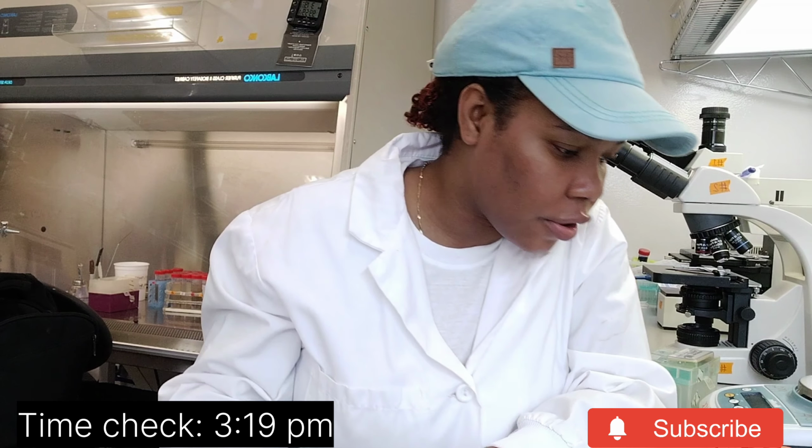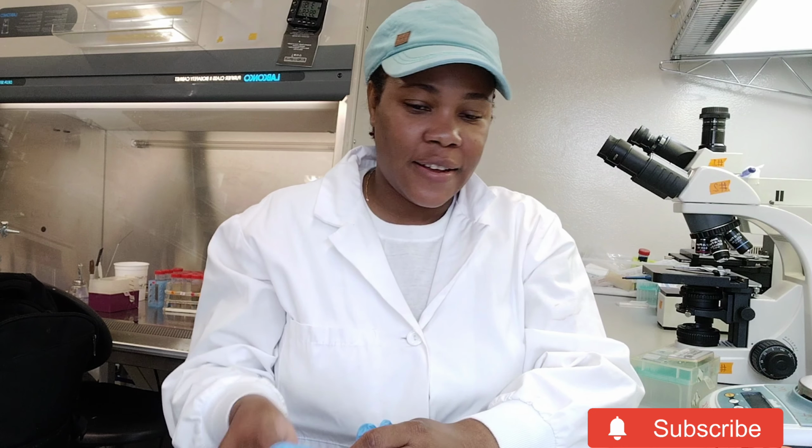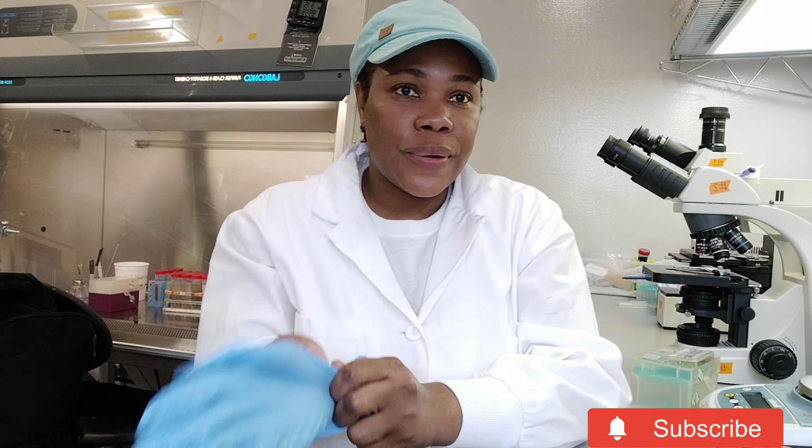It is after, what's that, 3? God, I'm tired.